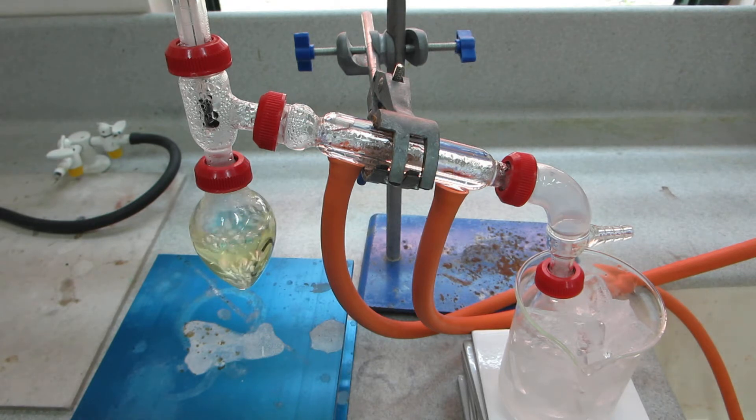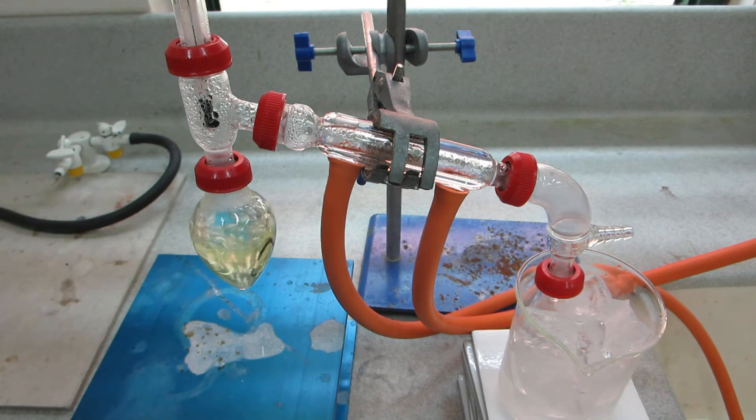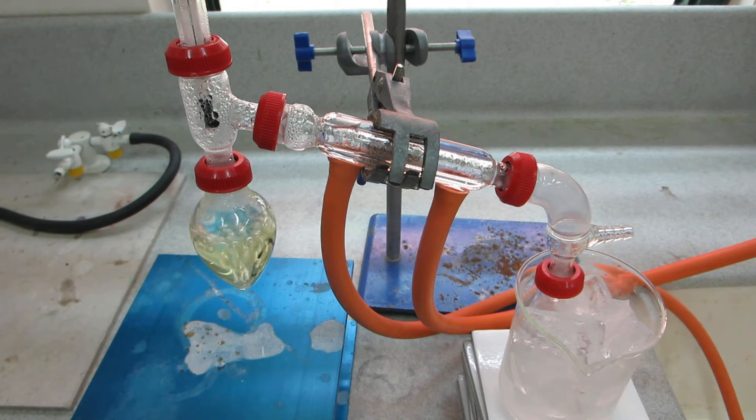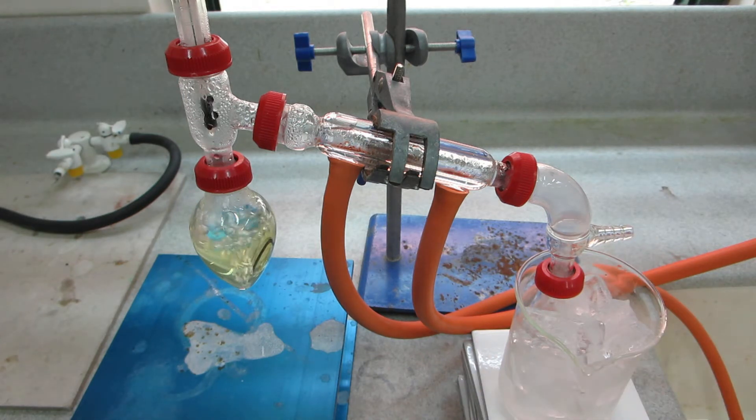What we really want is a nice, even boiling of the mixture during the oxidation reaction. It can get rather too quick, causing the whole reaction mixture to boil over if we're not careful.